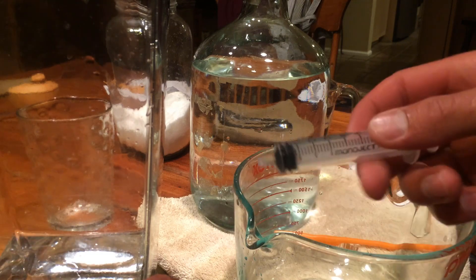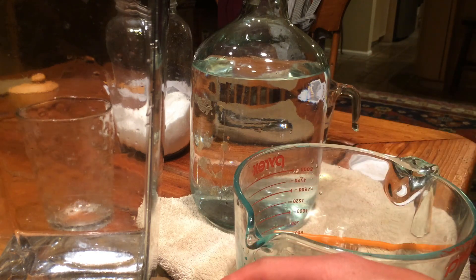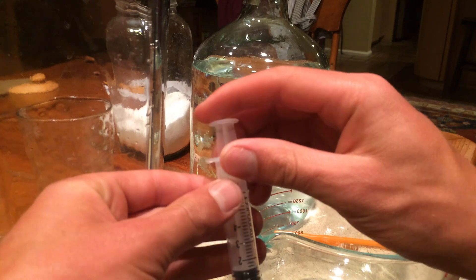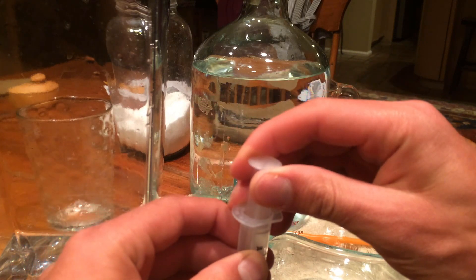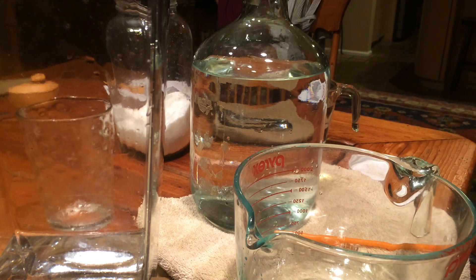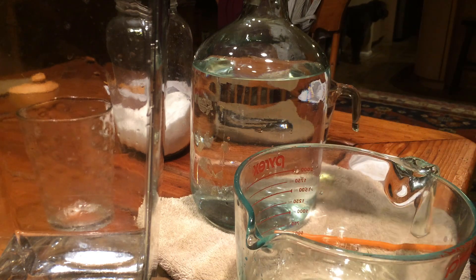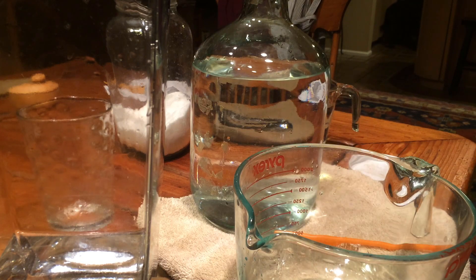I've got this small syringe and this F2 formula algae fertilizer. For a gallon jug you want it to be halfway in your vessel - you need one and a half milliliters of this F2 fertilizer. Then you take that fertilizer and squirt it into the gallon jug. Put away the syringe and cap off the F2 fertilizer.